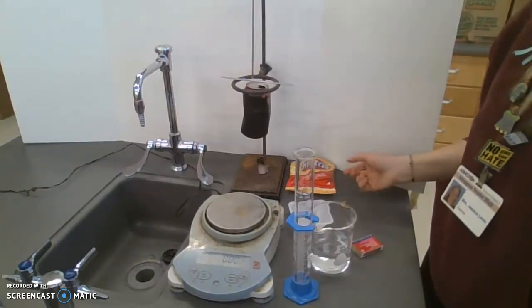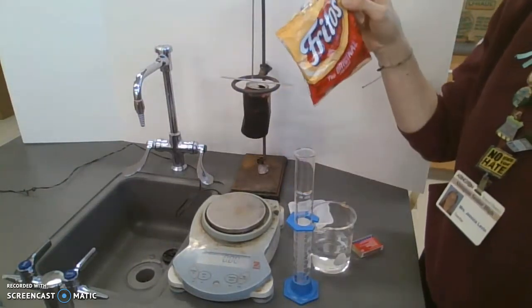All right, welcome everybody. This is the Food Calorie Lab.